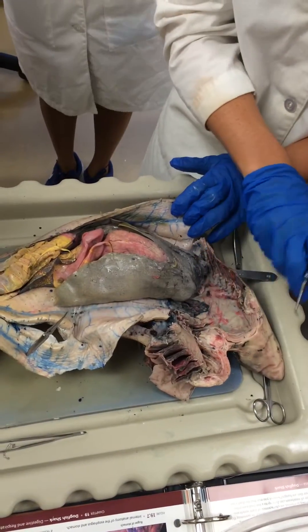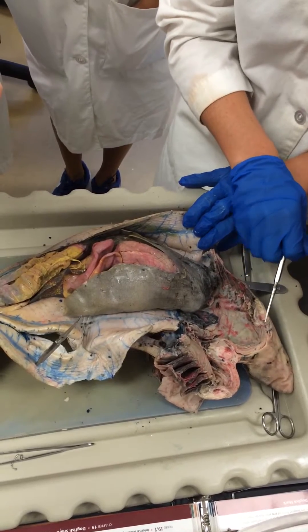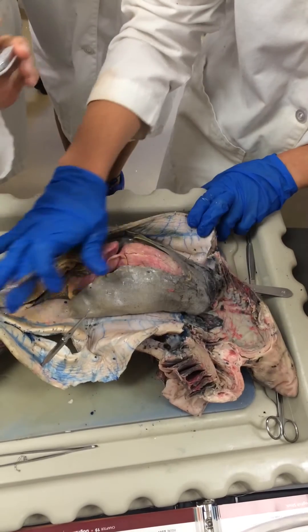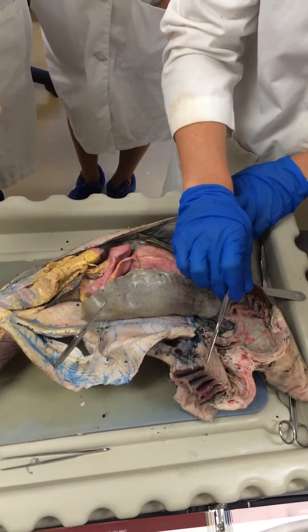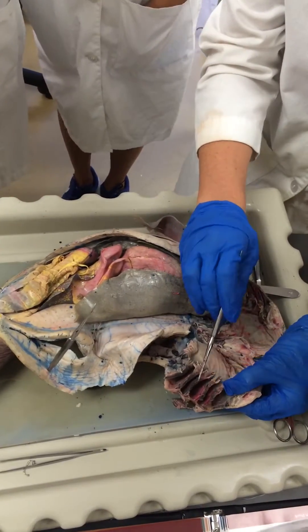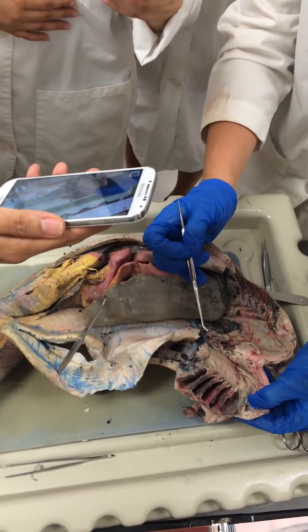We have the oral cavity up here, we have the teeth, and this section is the pharynx. Down here we have the pleuroperitoneal cavity. The tongue is right here. Each of these gill chambers here are called parabranchial gill chambers.